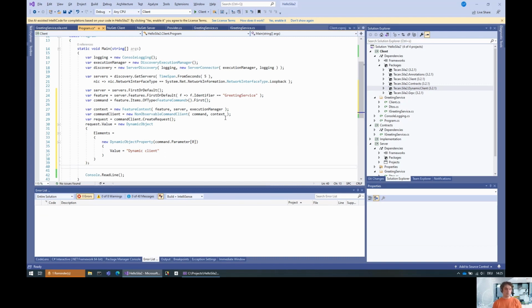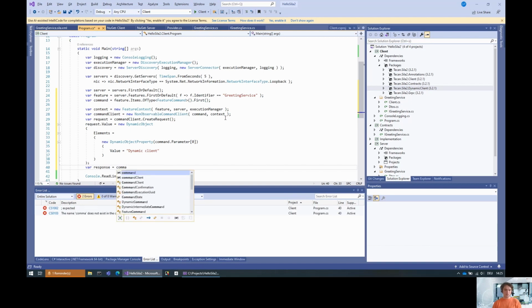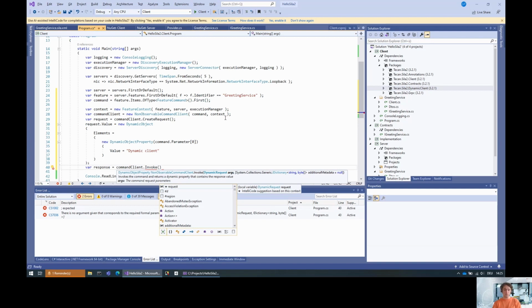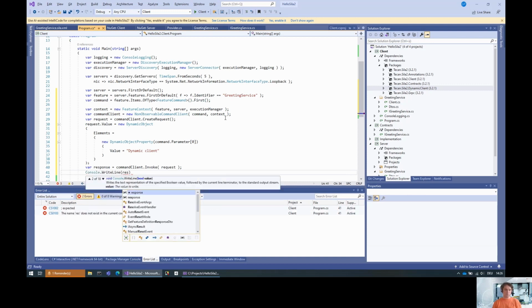Now we still need to actually execute the request, and for that, we just do console write line of the response. So first save the response, and that is command client dot invoke. There's also an asynchronous invoke, but here we use the blocking one. Namely the request. You can put in additional metadata if you wanted to, but we don't use that at the moment. We just execute the request as is. And then we do a console dot write line of the response.